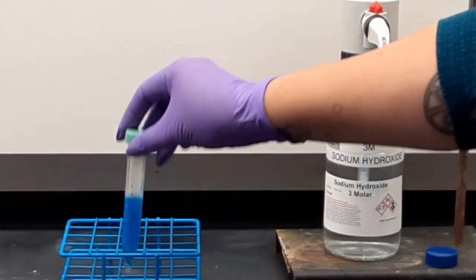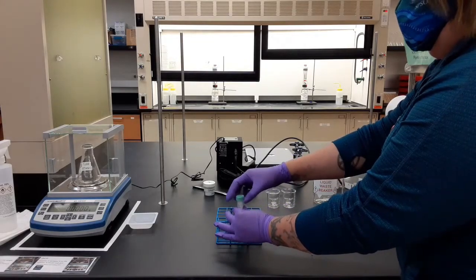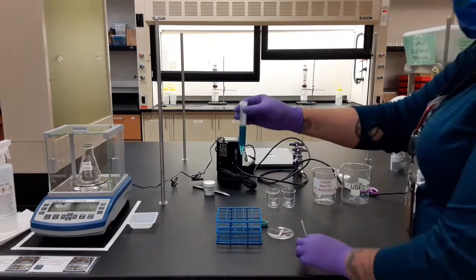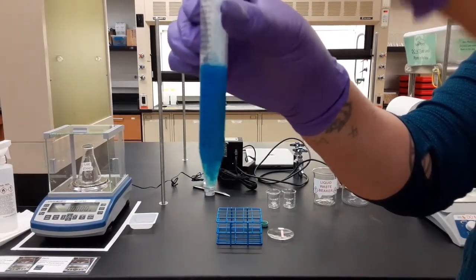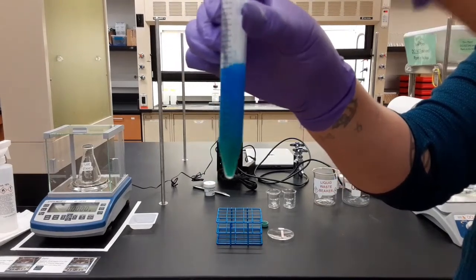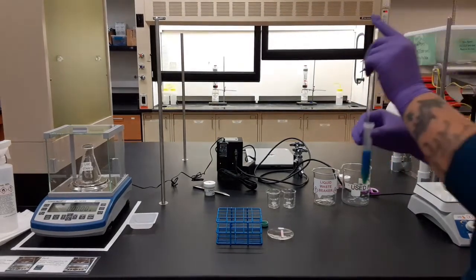And now back to your station. Okay, so back at your station now, you're going to take a glass rod and you're going to stir up your sample. Hydroxide is quite heavy. You're going to get some layering here. You need to stir this stuff all up.